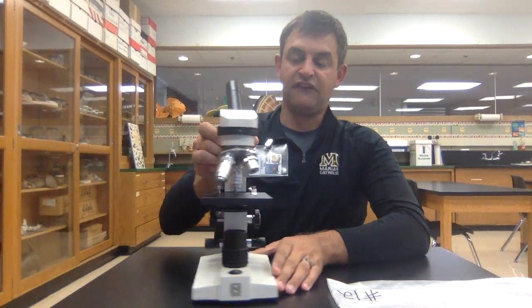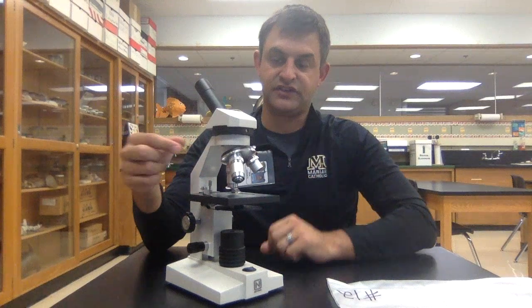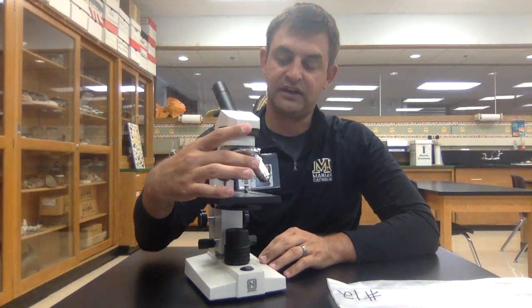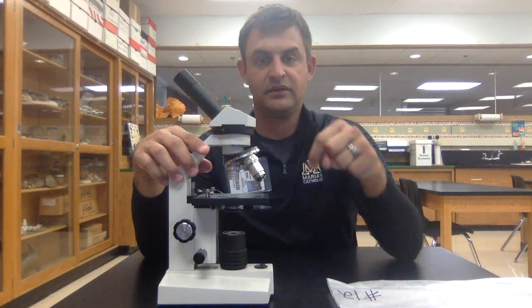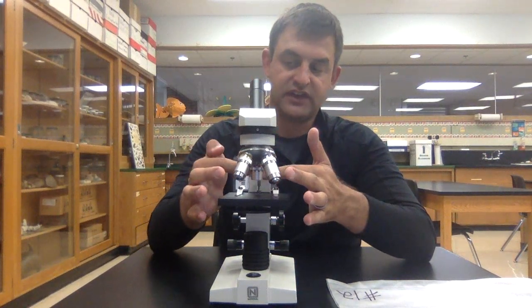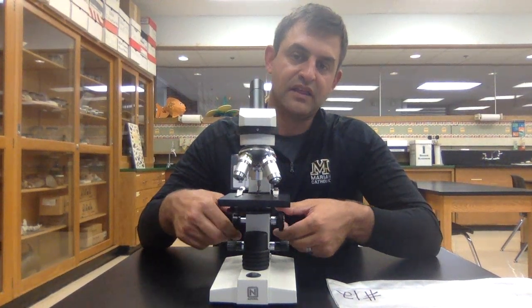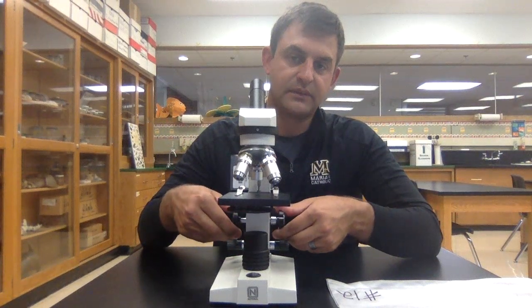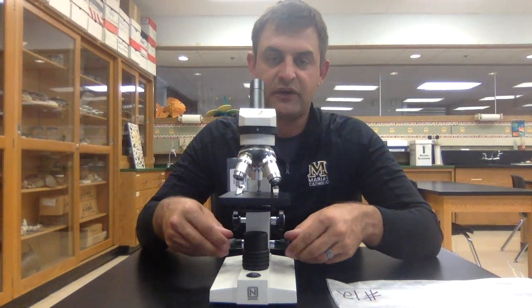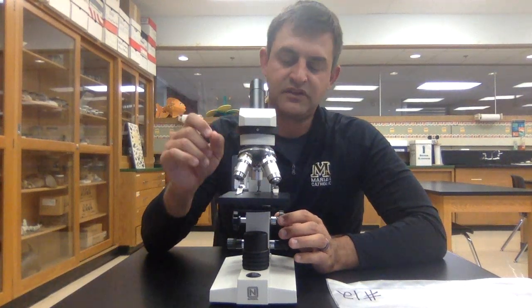Just a few pointers: if you put a specimen onto the stage, you want to start on scanning power, which is the red knob. On the red knob, you're moving the slide around until the image is in your field of vision. Then you're using the coarse adjustment knob to make that image come into focus. Once it's pretty well in focus, you can use the fine adjustment knob a little bit to sharpen that image.